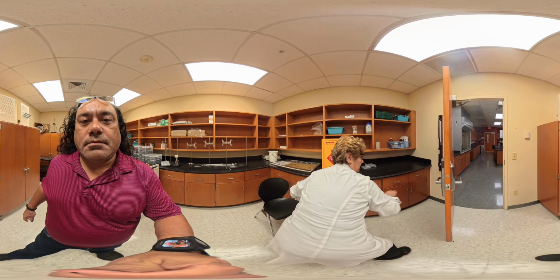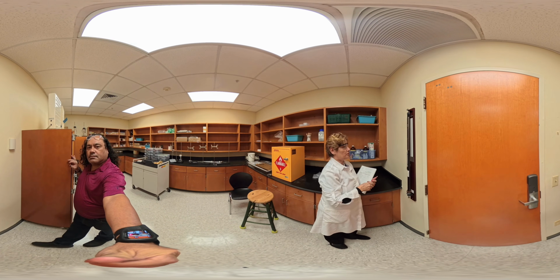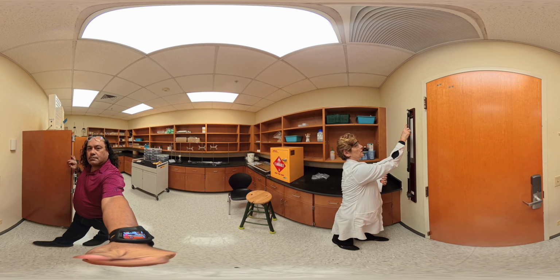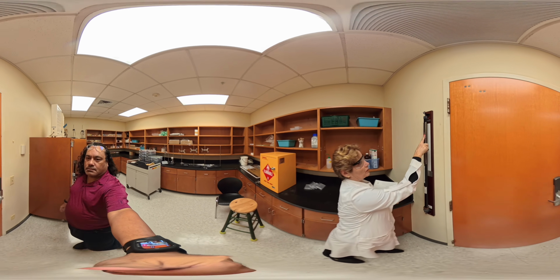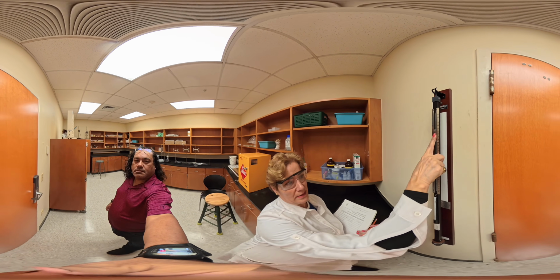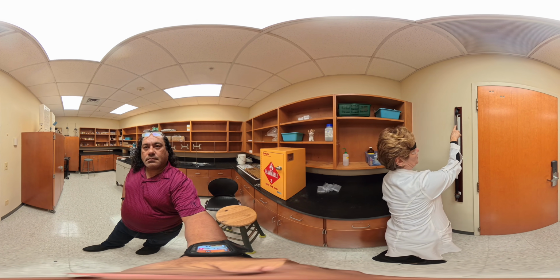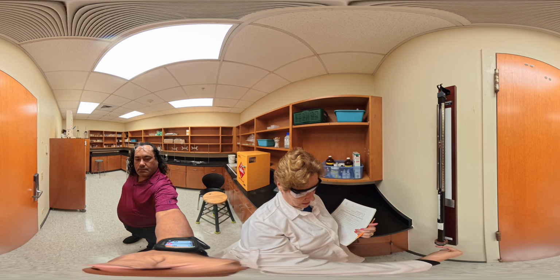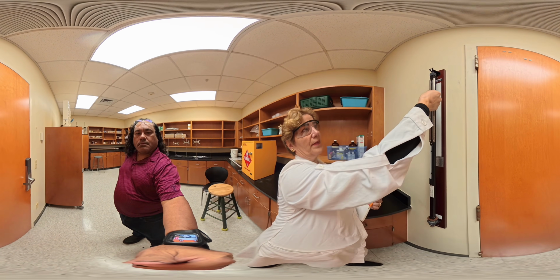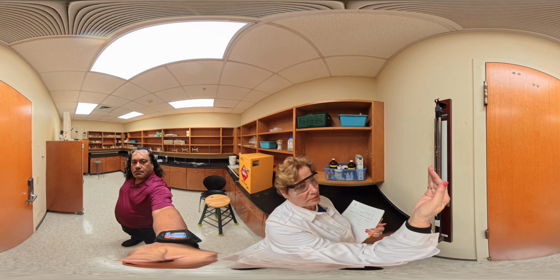The barometer is right here. It's placed right here, and that's what we are using for measuring the pressure. That's the device that measures atmospheric pressure. And if you look closely, we have the level of the mercury. This mercury shows the height of the mercury. It shows what the pressure is.